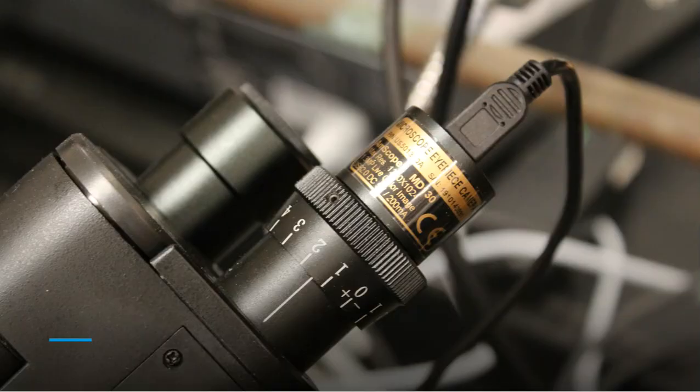All right, guys, so a few pictures I want to share. This is what a camera looks like a little closer up, at the eyepieces traditionally of a microscope. And again, we just think that this is a little more convenient. It's better. It's coming from the software. It's getting saved on computers. You can save images. You can save video. It just really depends on what you're looking for and what your needs are. But just a simple little USB camera, nothing fancy with it at all, that gets connected directly to our computer and feeds that information into the software that helps operate the microscope.